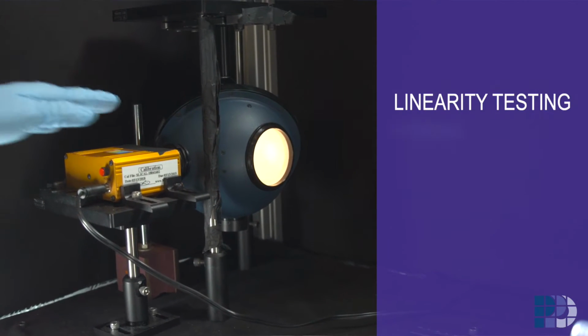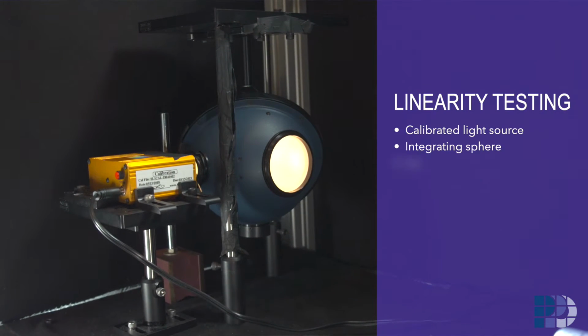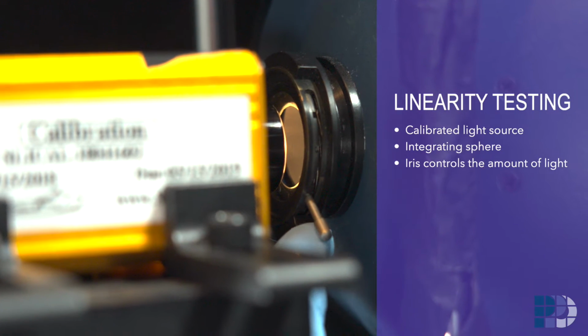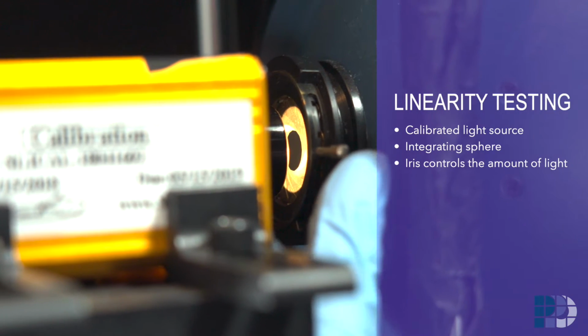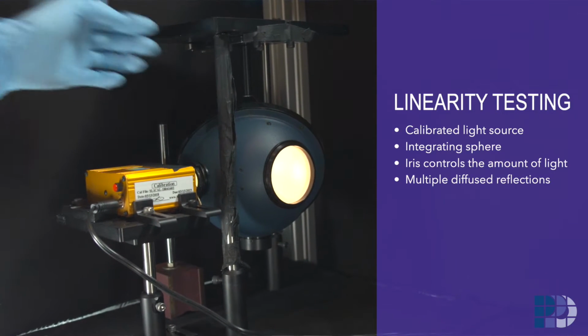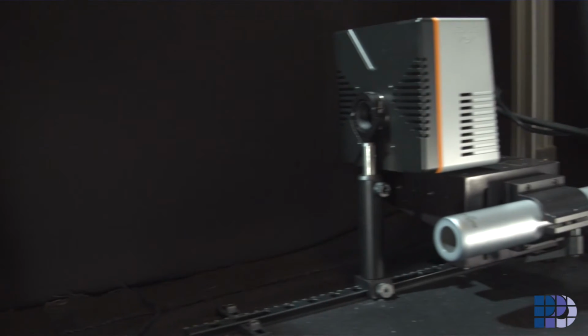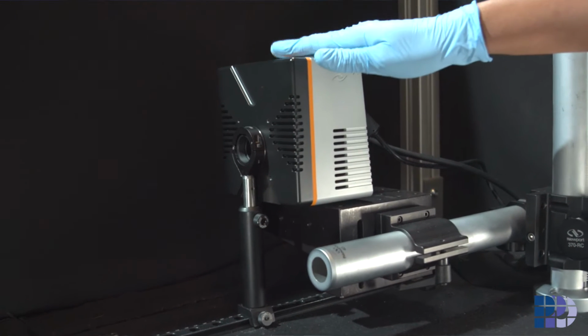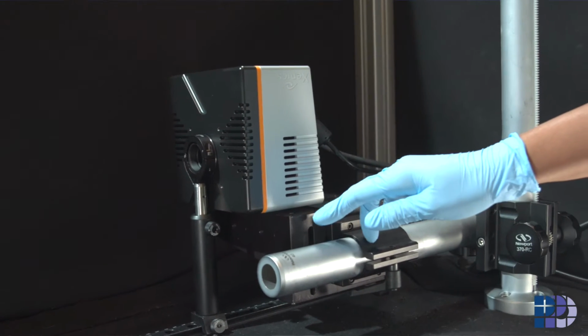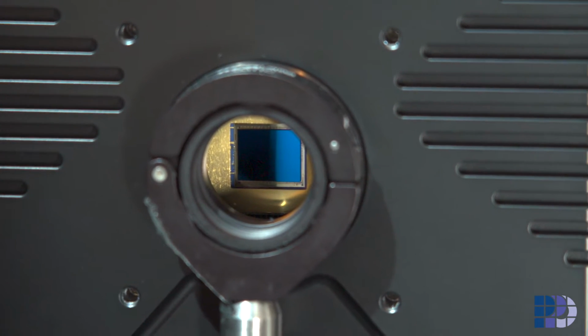We have light from a calibrated halogen light source entering the integrating sphere. The amount of light is controlled by the iris. The integrating sphere is coated with a special material so that light striking its walls undergoes multiple diffuse reflections. The light that comes out of the sphere is hence uniform. This uniform light from the integrating sphere is now collected by the camera that is mounted on a stable optomechanical fixture. This ensures that all the camera pixels receive the same amount of photons.